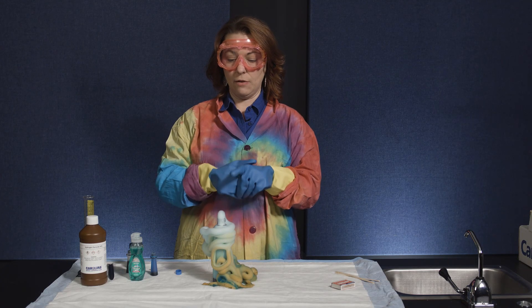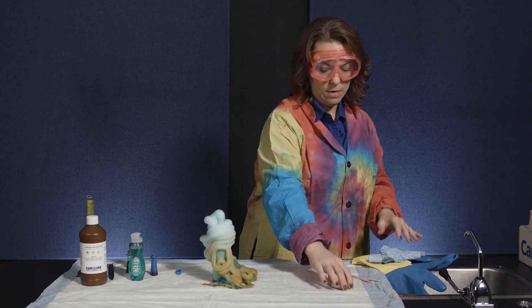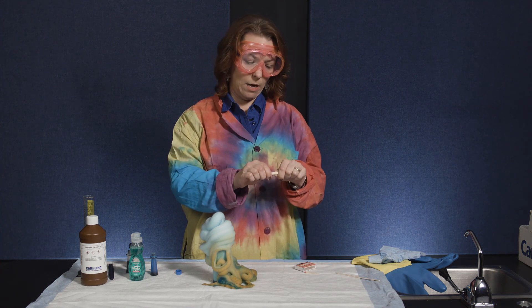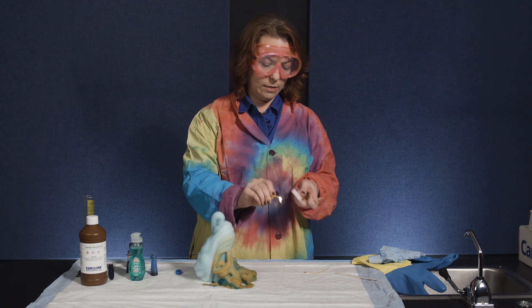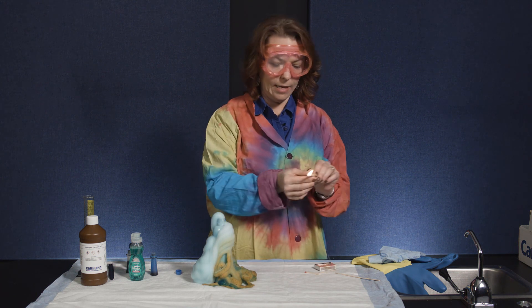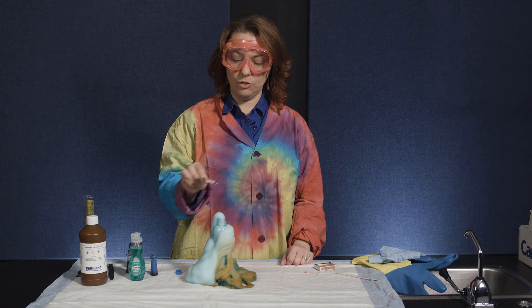One cool thing we can do is prove that it's oxygen gas actually being evolved from the top of this bottle. We take a glowing splint that's not quite lit anymore, and if we can get it to flare back up, it proves it's been placed into an oxygen-rich environment. So we light the splint, then almost make it go out so it's just glowing — and when it pops back up, you can see it's in an oxygen-rich environment.